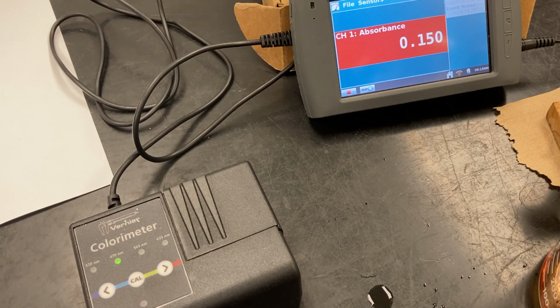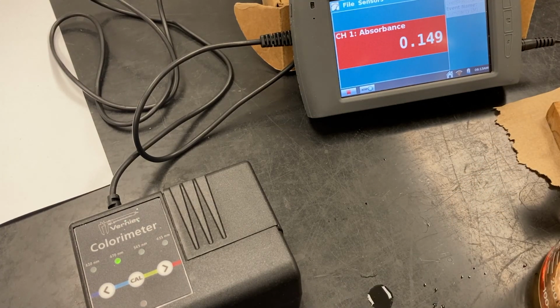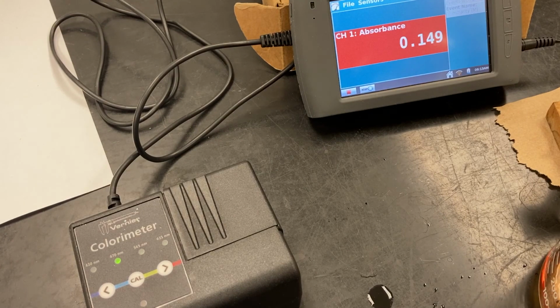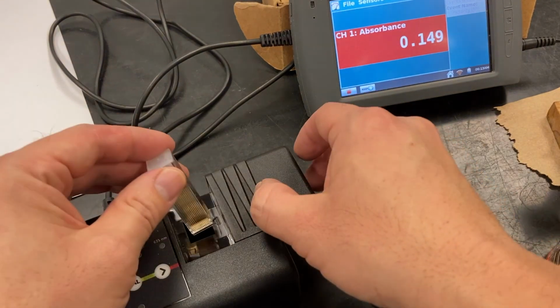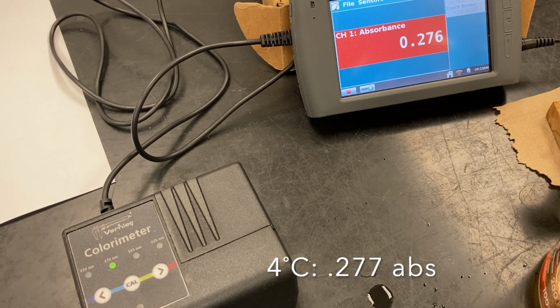So rinse a couple times. All right, so 4 degrees. 0.277.